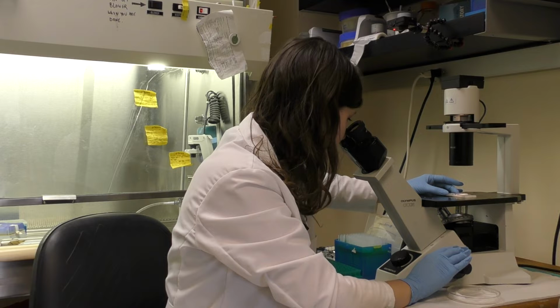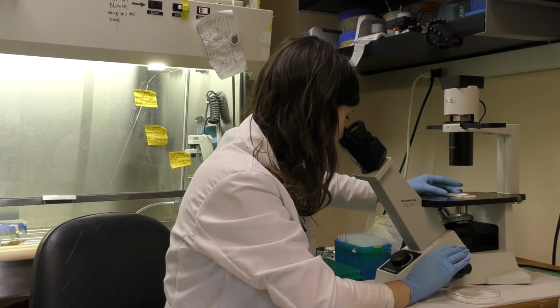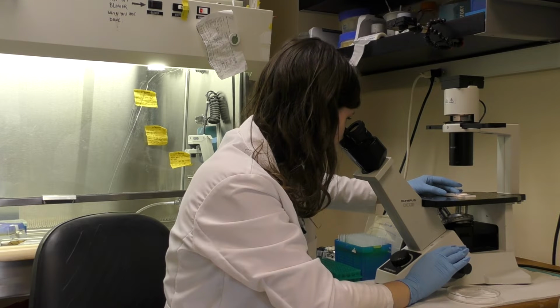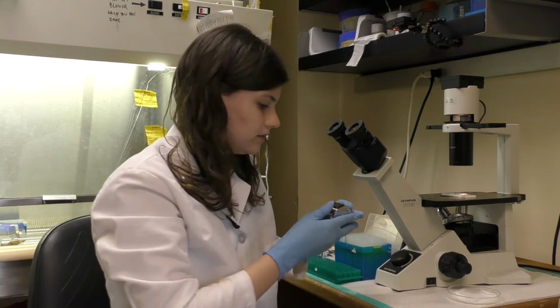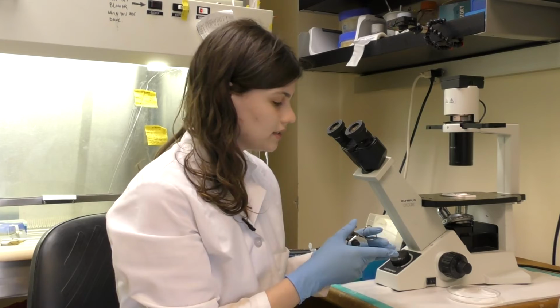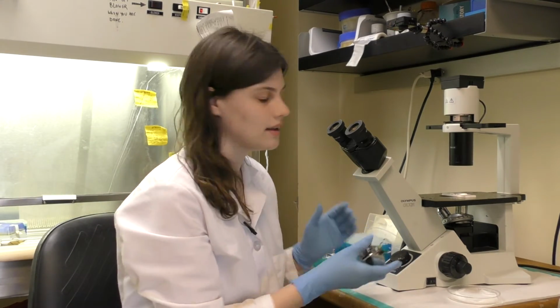So the hemocytometer has a little grid system, and in the 4 corners are the boxes that we want to count, and so there's going to be 4 boxes of 16 squares on one side and 4 boxes of 16 squares on the other side, and we're going to count up all of those cells. To get our live cell value, we can just count the cells that are negative for trypan blue, because trypan blue will stain our dead cells.